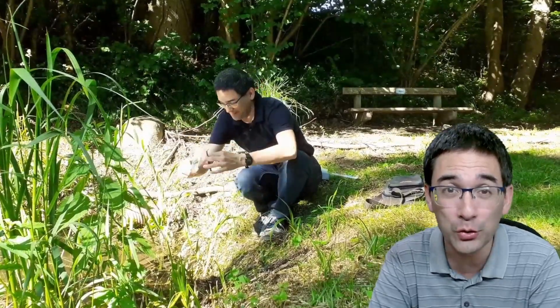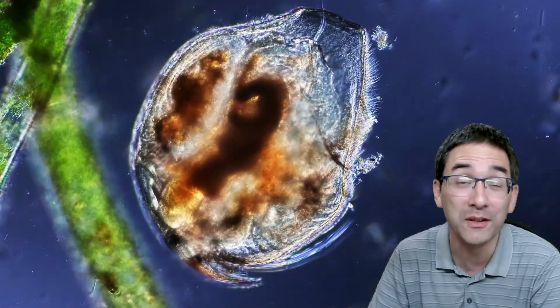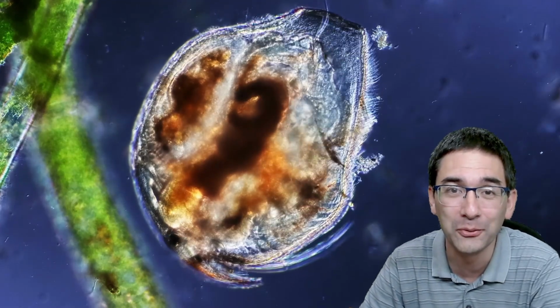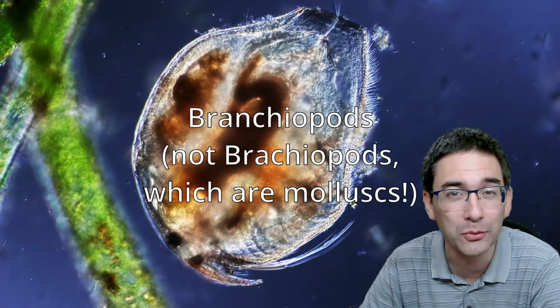After all, because of photosynthesis, it's producing a lot of oxygen, and this means that I expect to find many small microorganisms there, which basically settle down on the surface of the algae. And therefore, I was quite confident to find something here. And sure enough, I found a little water crustacean, and branchiopods, these are called, if I remember correctly.